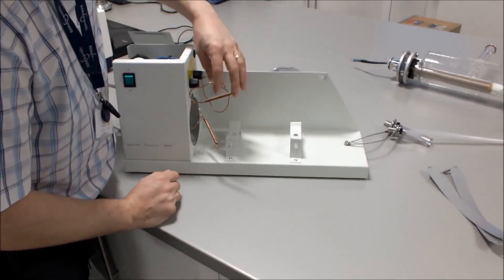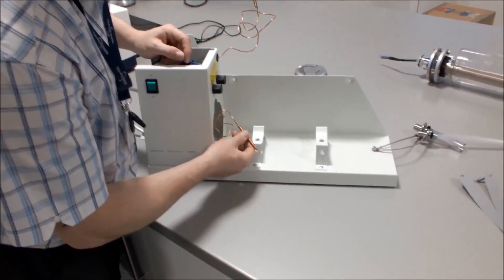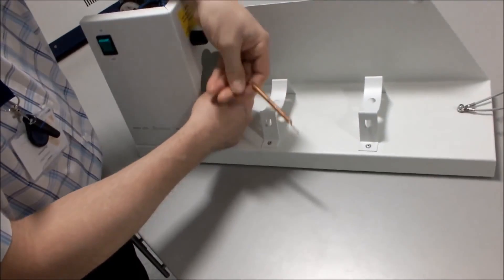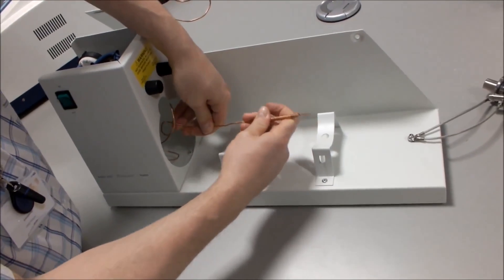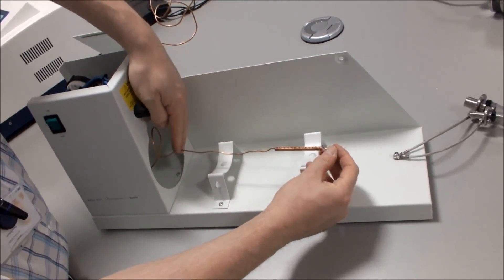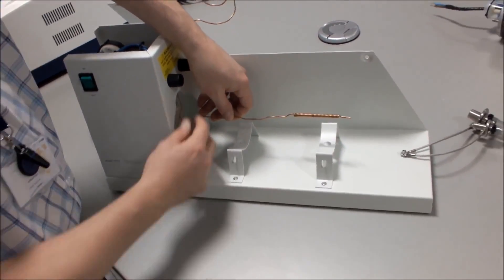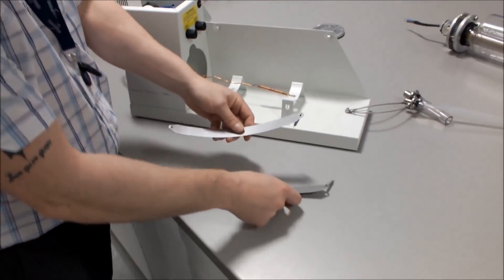On our unit we have two thermostats. The upper one is the condenser thermostat and the one at the bottom is the boiler thermostat. We need to unravel the boiler thermostat until we have approximately 250mm straight from the end, so we can place this inside our boiler.